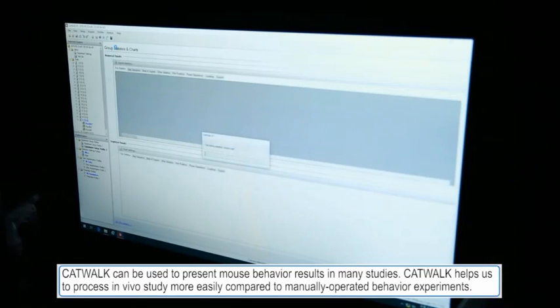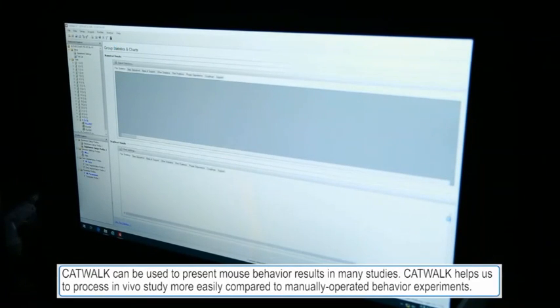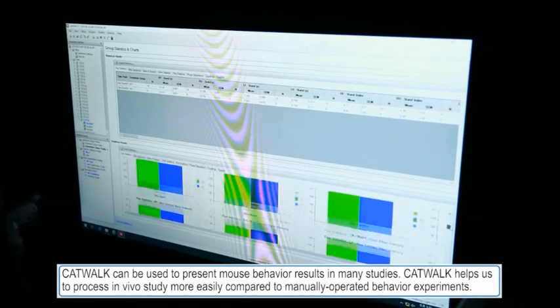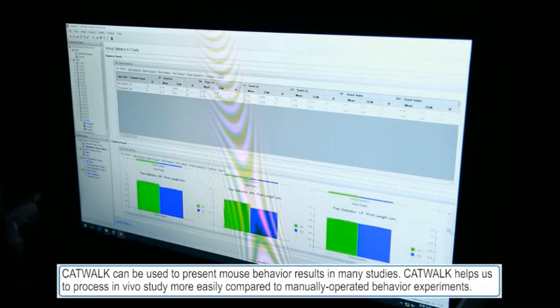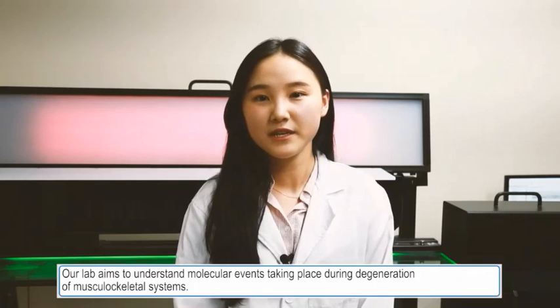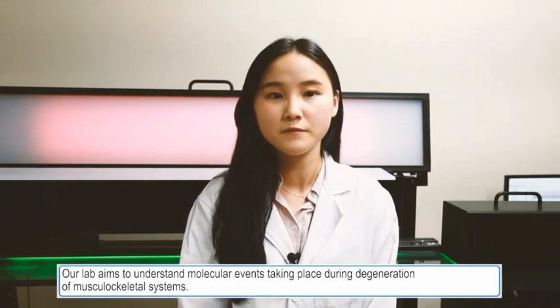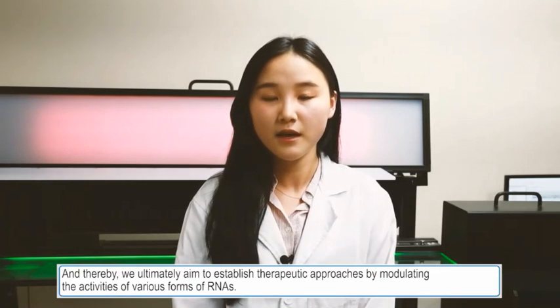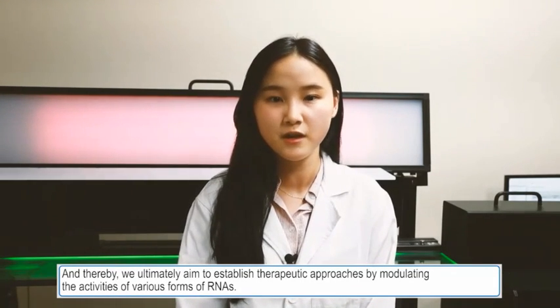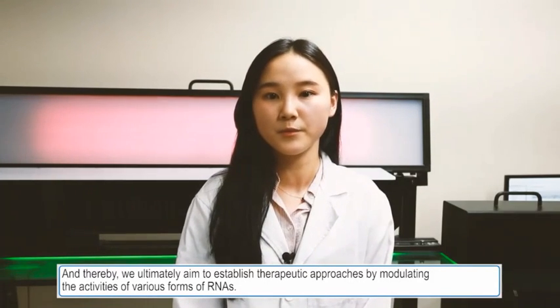CatWalk can be used to present mouse behavior results in many studies. It helps us process in vivo studies more easily compared to manually operated behavior experiments. Our lab aims to understand molecular events taking place during degeneration of musculoskeletal systems, and ultimately to establish therapeutic approaches by modulating the activities of various forms of RNAs.